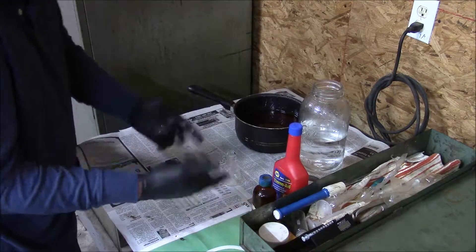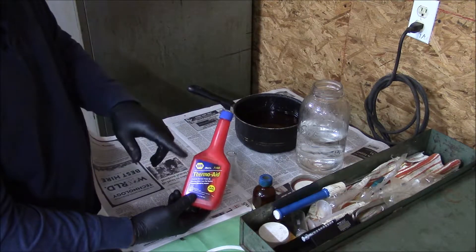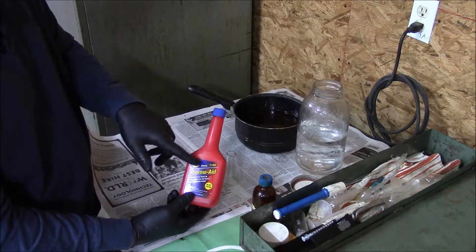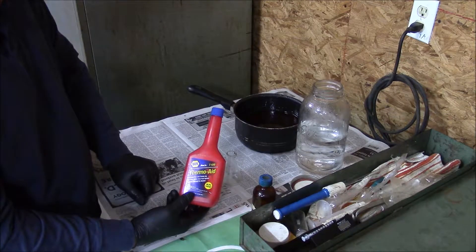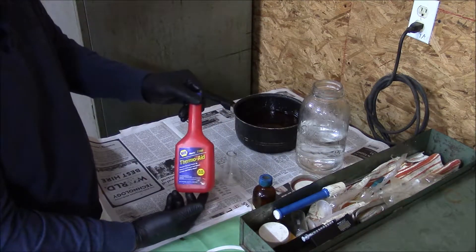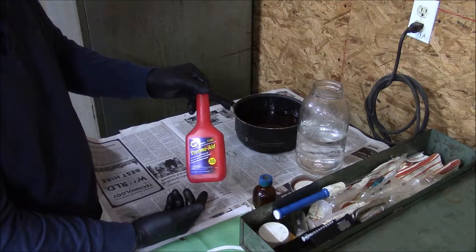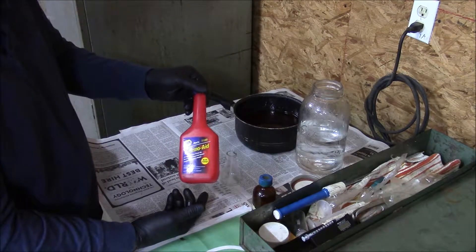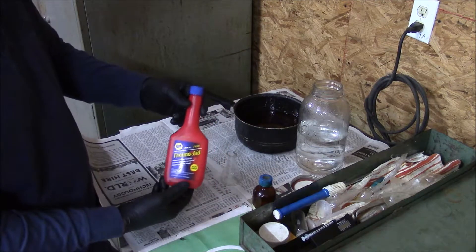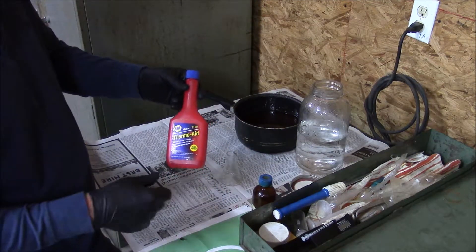This is the process that I use. You need isopropyl alcohol, and I have found that Napa's ThermoAid is 99.9% isopropyl. I believe I've found these in bulk for under $2 or about $2.50 or so. It's a really inexpensive way of getting the isopropyl you need for the titration.